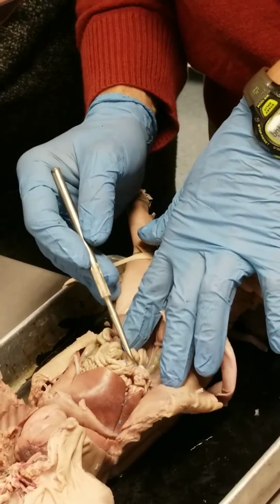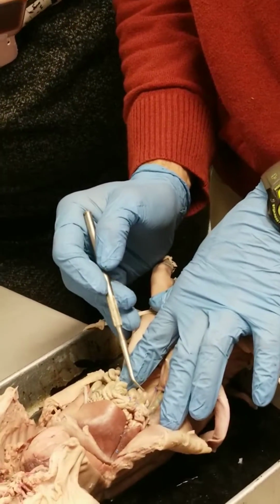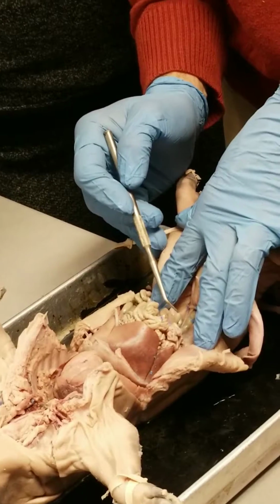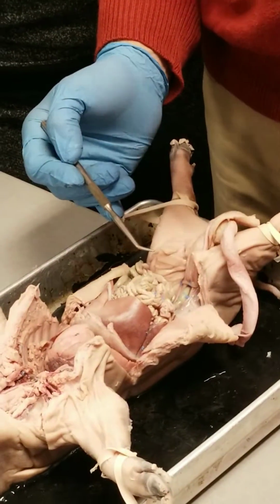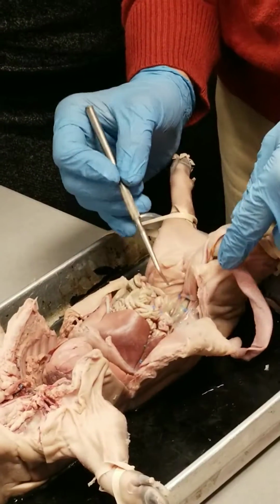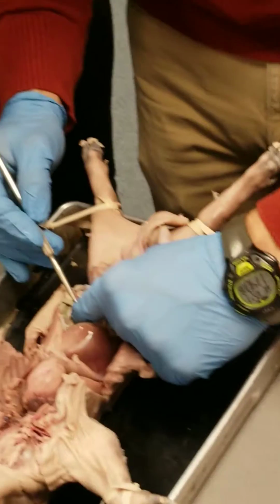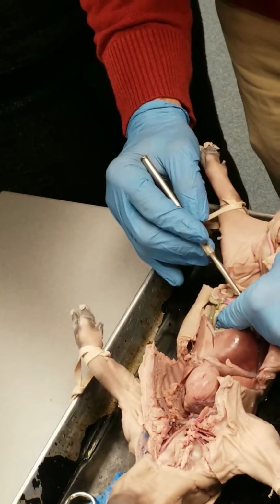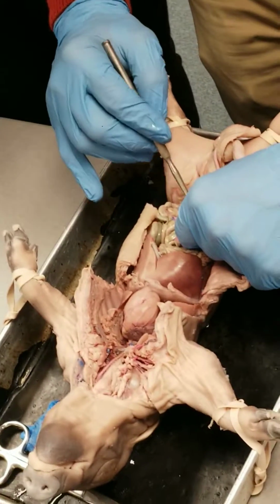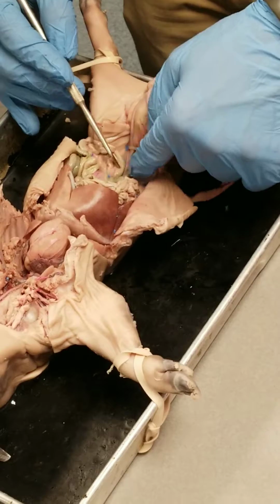It was interesting to see what people would tell me was the appendix, but this is the cecum. It's just a blind-ended pouch. It looks like the head of an earthworm. That's how the large intestine begins, with this little pouch, the cecum. You can sometimes then find that portion of the small intestine, all this thin beige, coiled tube. That's the end of the small intestine, the ileum. You can see where it hooks up with the large intestine.